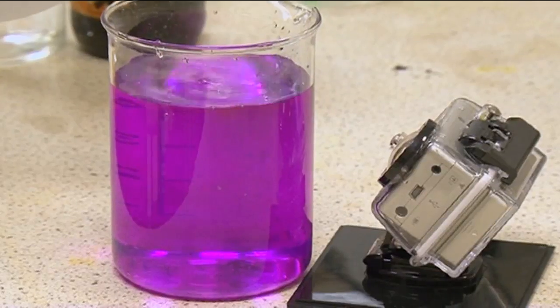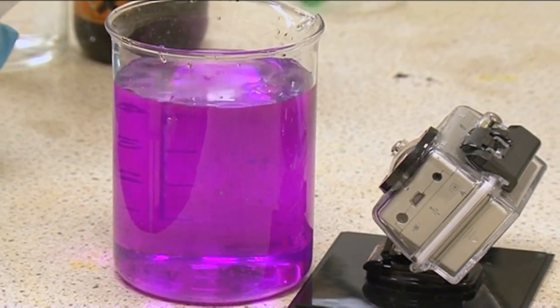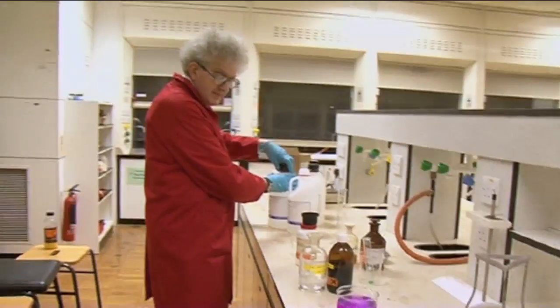I think it may be flat. Try another bottle. I'll get some of my own hydrogen peroxide instead.